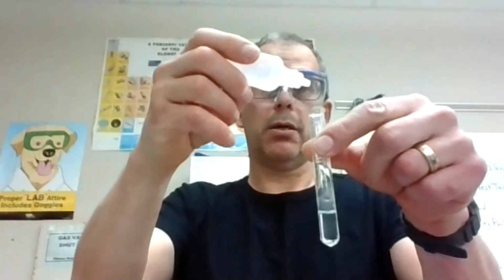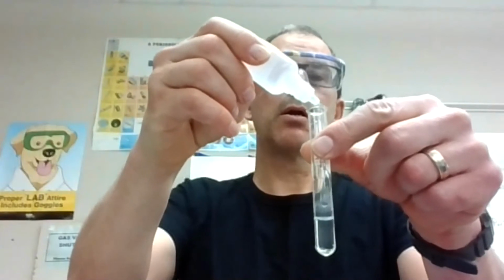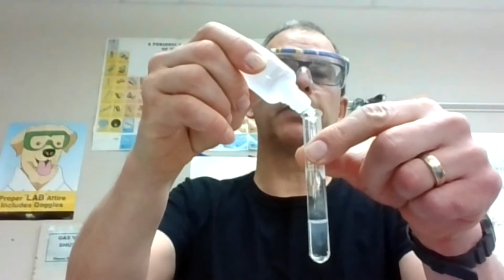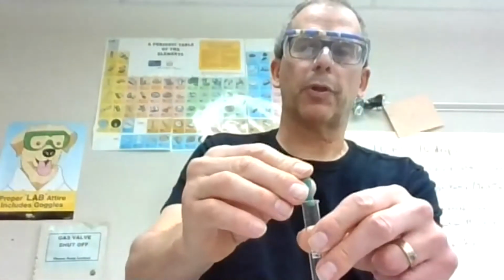Here we go. I'm looking for OH. I'm going to add this here. And let's see, 1, 2, 3, 4, 5, 6, 7, 8, 9, 10. This one's kind of interesting because you can see maybe just a little fogging near the top, but it doesn't look like much. And what I'm going to do is just give it a quick mix. I'm going to put this on and really just do one quick flick.